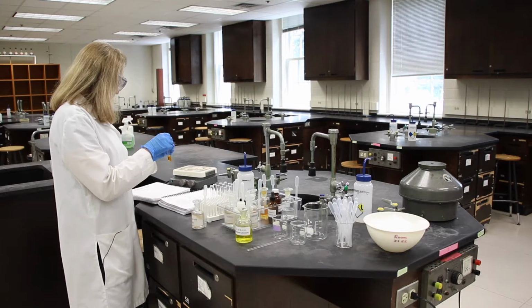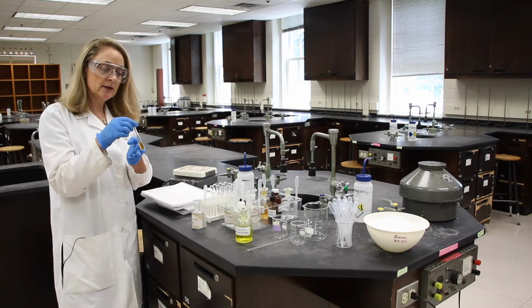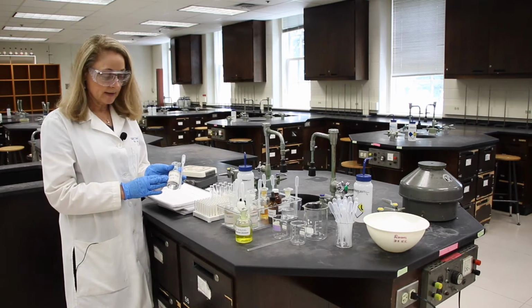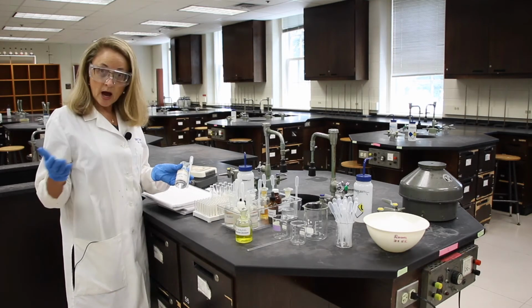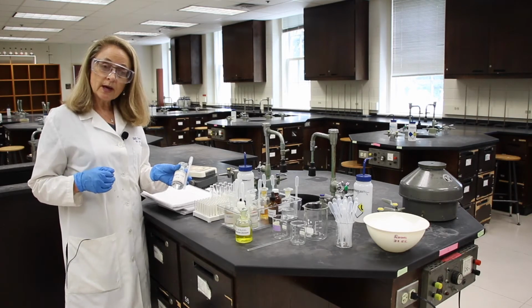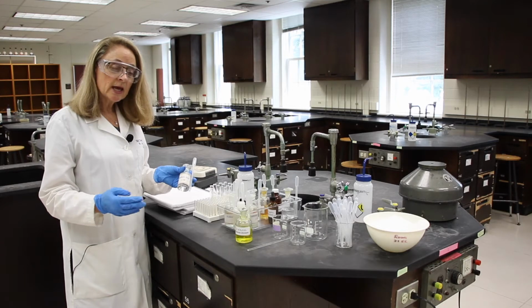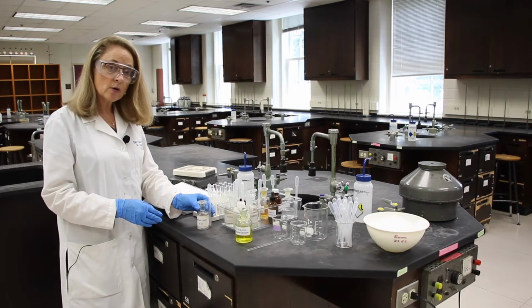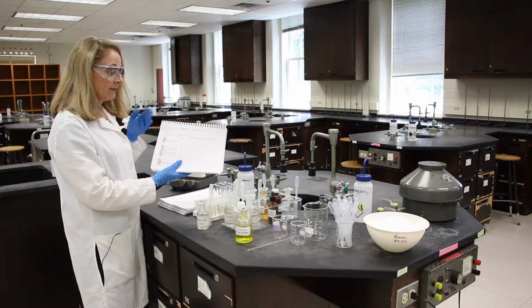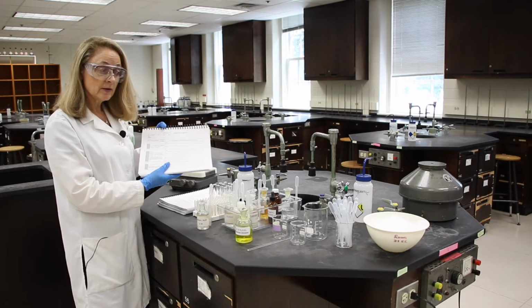Okay, so it says mix, record any observations, and answer the data question QA1. All right, so we'll do that. In step A3, we can say the stress on the system, and we added sulfuric acid. Sulfuric acid is made up of hydrogen ions and sulfate ions. Now the first thing you're going to ask is, do I see either the hydrogen ions or the sulfate ions in my balanced net ionic equation that is at the top of the data sheet? And yes, I do see the hydrogen ions. It's on the reactant side.